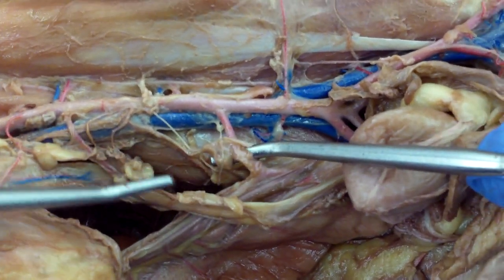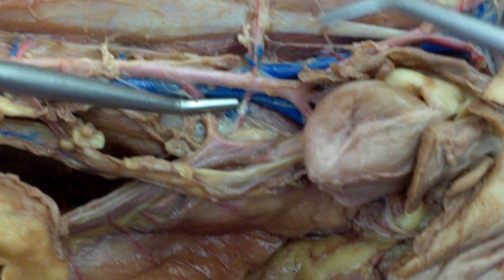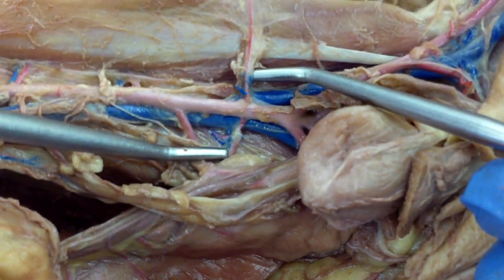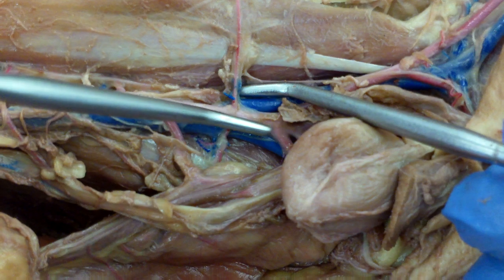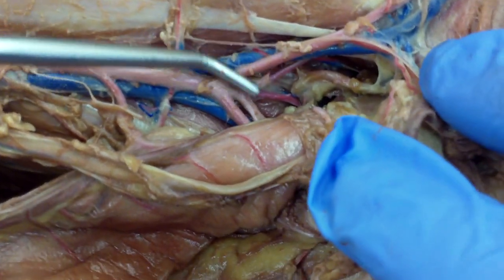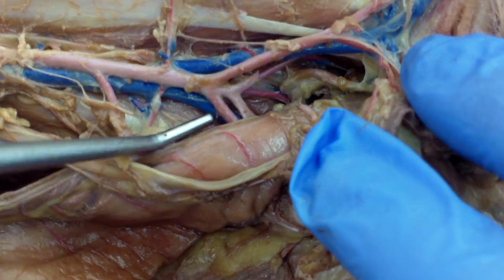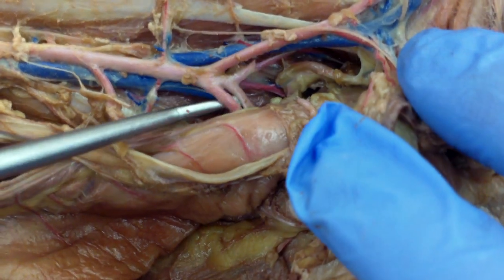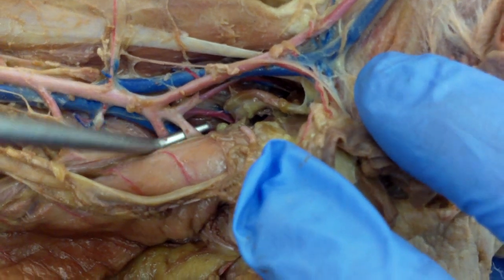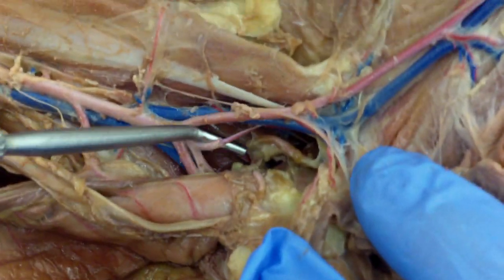And then you have your iliolumbar, which splits — just these little guys on both sides. Still continuing down your descending aorta, you have a split for your external iliac on both sides, and then more deeply you have your internal iliac on both sides.